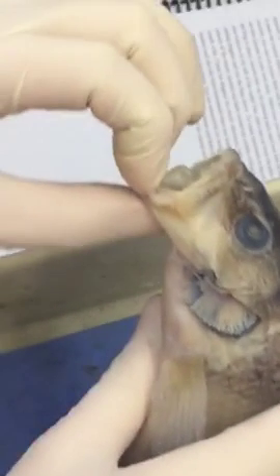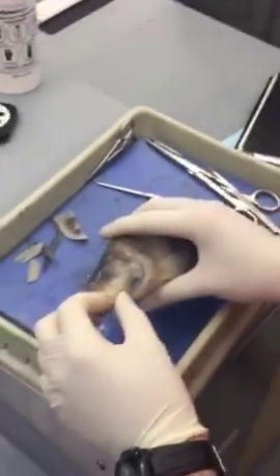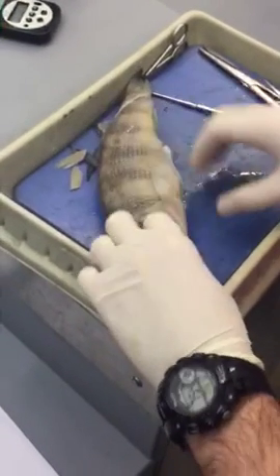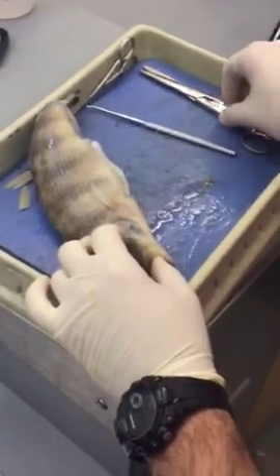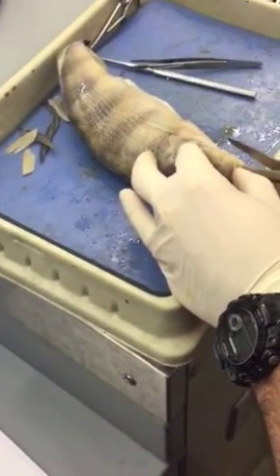Now this is the eye. We talked about before how the mouth opens and closes — it's actually pretty significant. You can see that they open pretty wide. Internally, you can see the tongue as well.